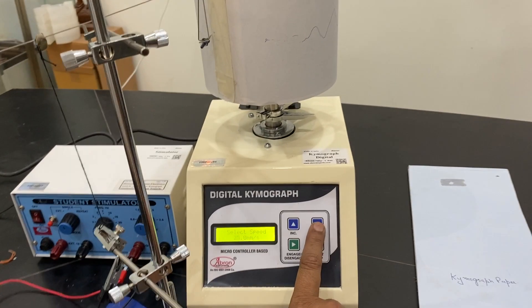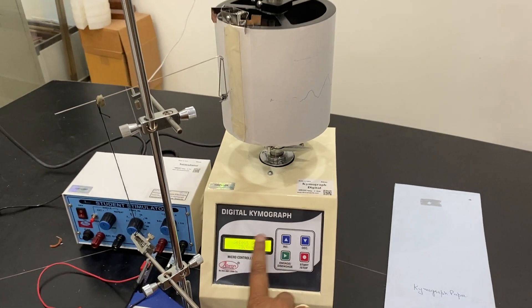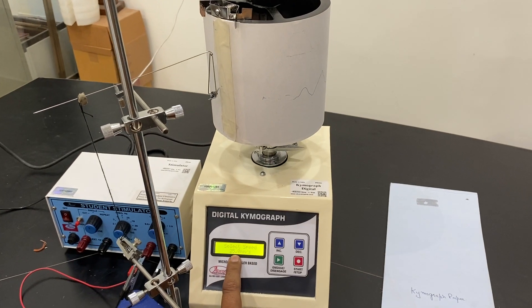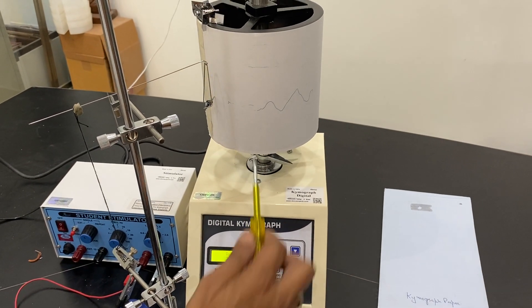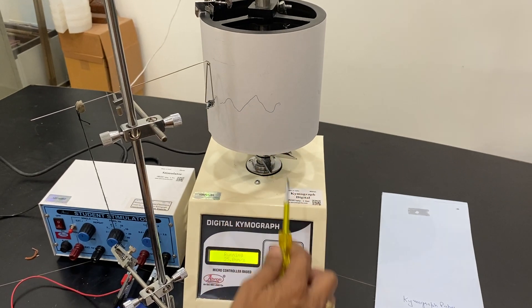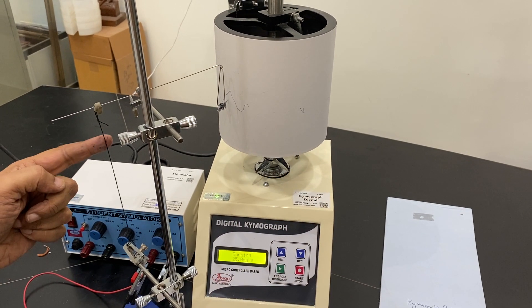This is a digital setup. I can use a lower one. I am using 25 millimeter speed. Now I show you, if I start it, it will give you... this is just one graph I have done. If I move this.